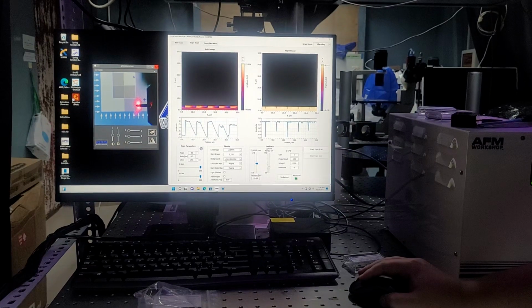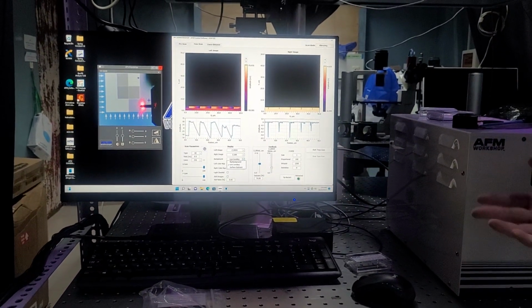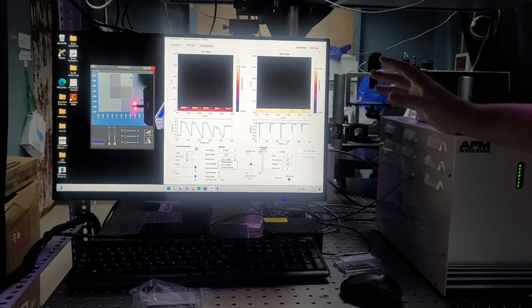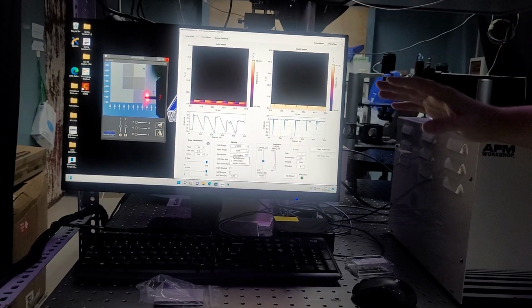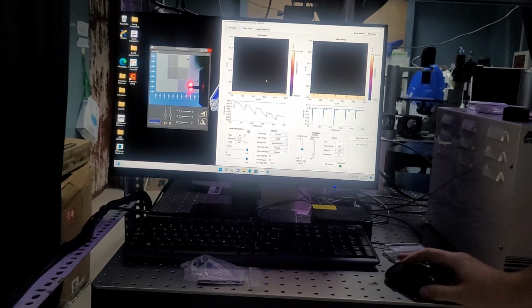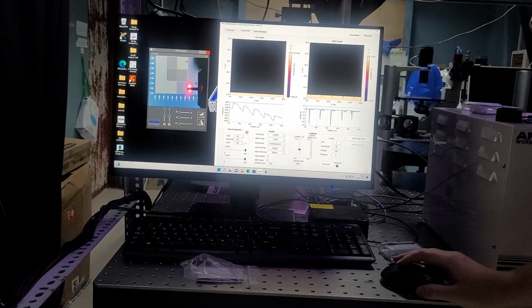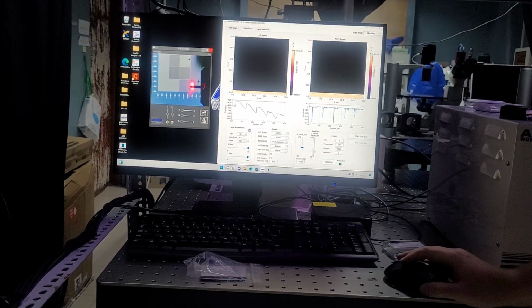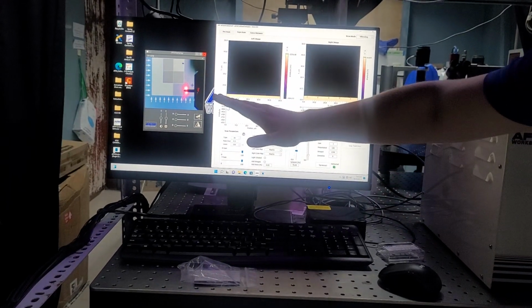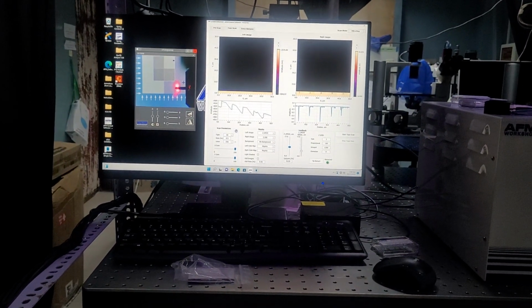Below that we have our background. So this just provides a basic leveling within the software. It does not change the actual values that are saved. All of the values that are saved from the AFM software are the no background values like this. And so you can see what I was mentioning before in the presentation, that it's at a very slight tilt. And that's just because it's very hard to make things flat.